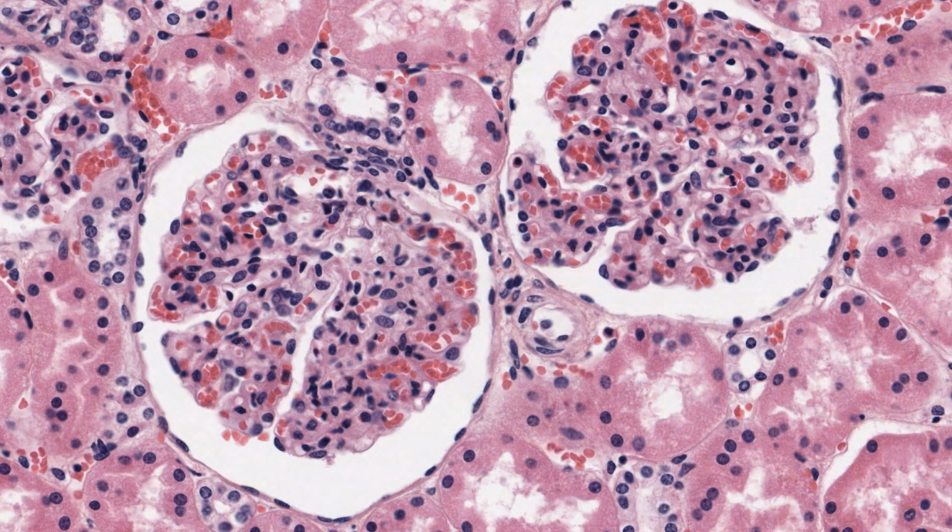When cut along their length, cells of this epithelium are visible as a very thin layer, and the nuclei appear to be very elongated and dark. Think of how the yolk of a fried egg would look in cross-section. Like most types of epithelia you're going to view, the shape of the nucleus mirrors the geometry of the cell.